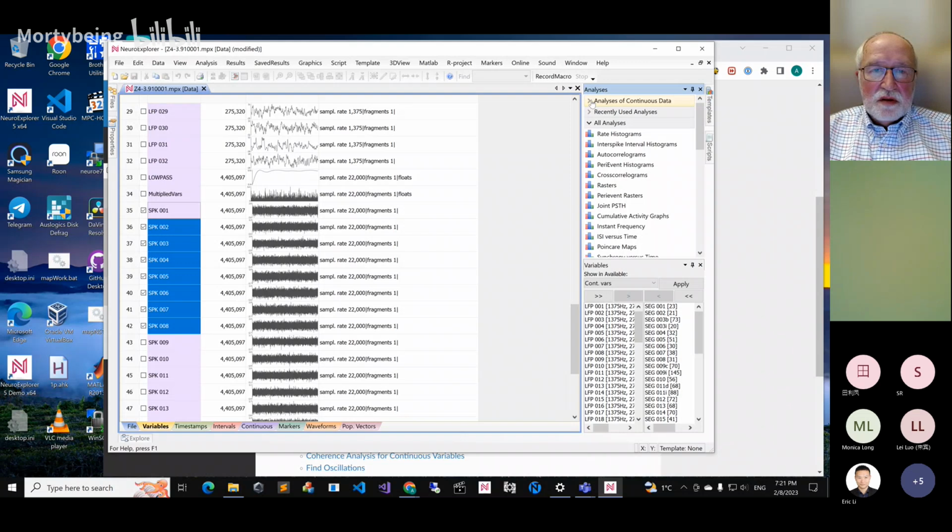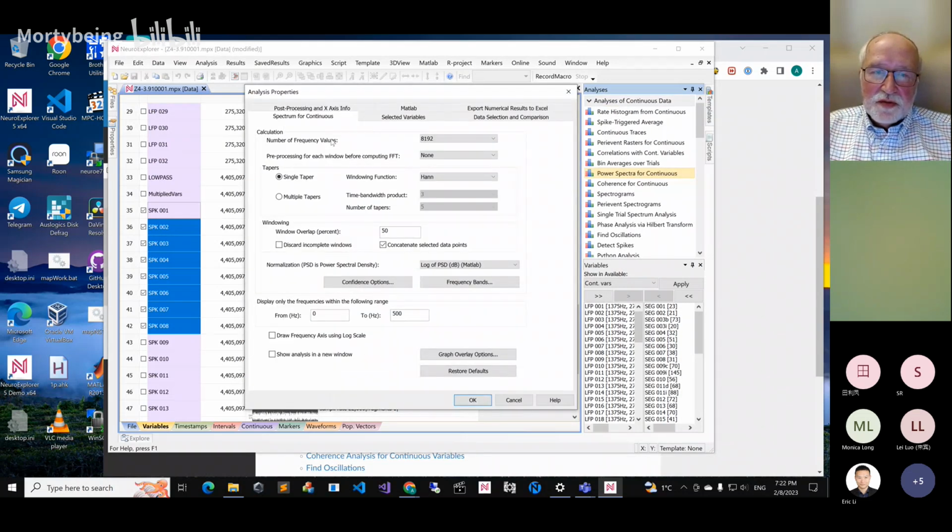The way the spectrum is calculated is that there is a sliding window of a number of points, and you calculate the Fourier transform for each window. It's called a periodogram estimation of the spectrum. The first value defines how many values will be in the spectrum. So let's do something simple like 128 and see what happens.